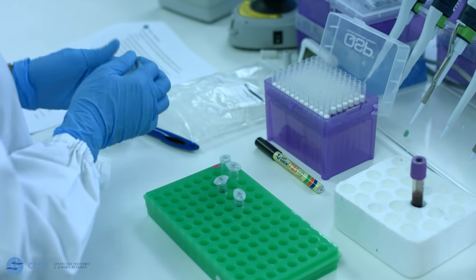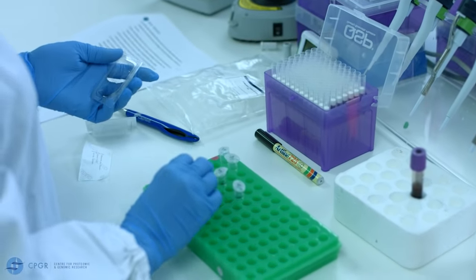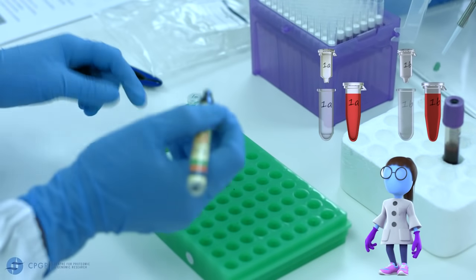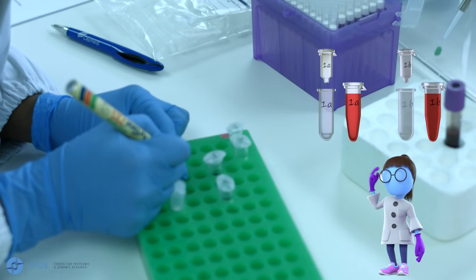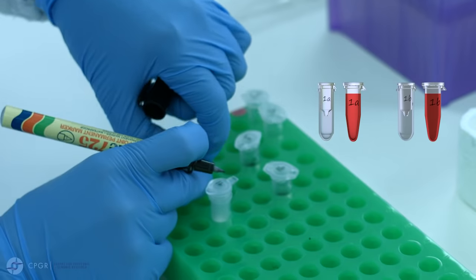Prepare a mini spin column for each sample. Label your spin column, ensuring that each spin column corresponds to the sample ID.